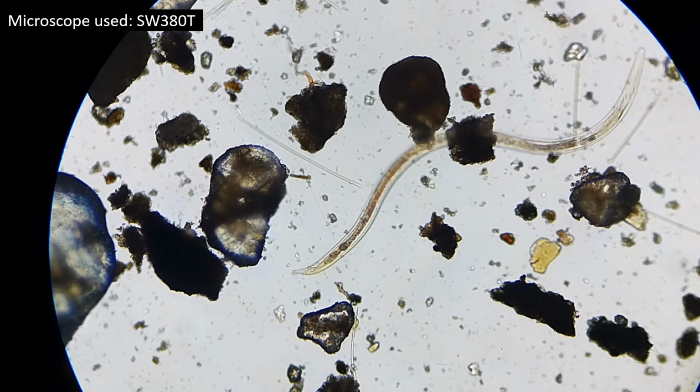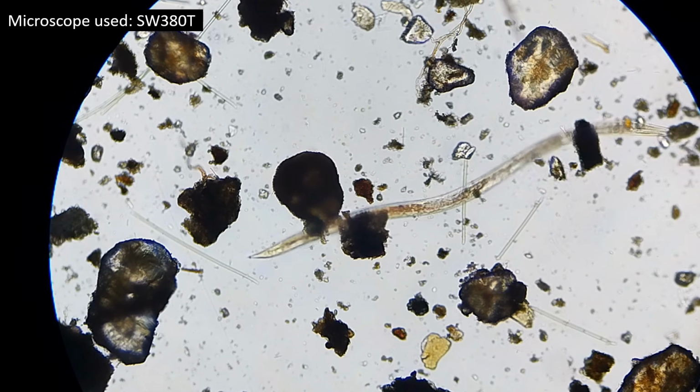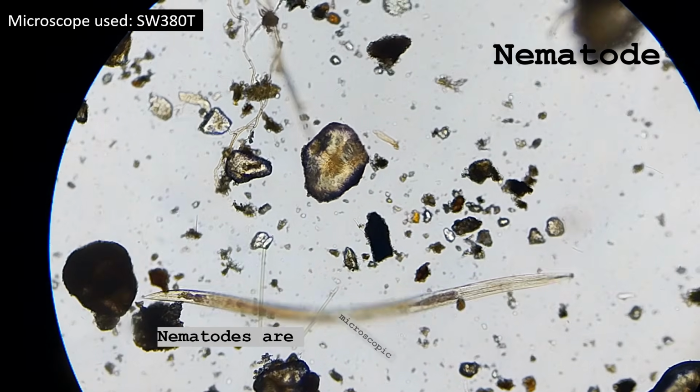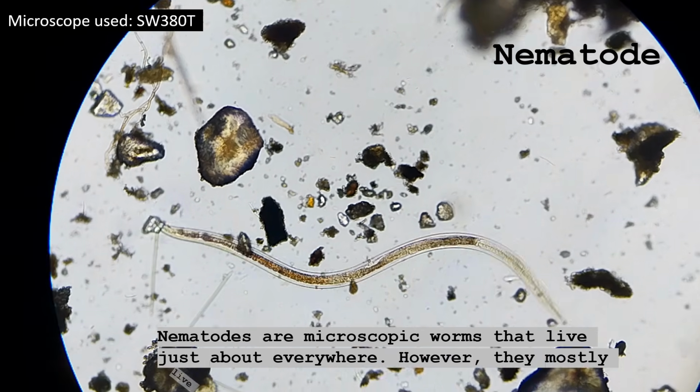Another animal commonly found in my moss samples is the nematode. Nematodes are microscopic worms that live just about everywhere. However, they are mostly found in soil and freshwater habitats.